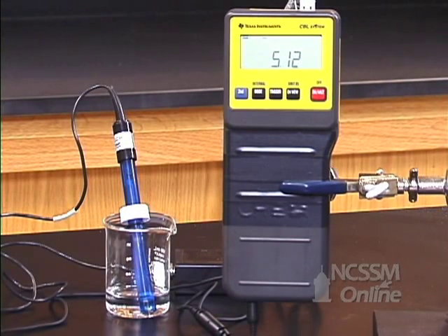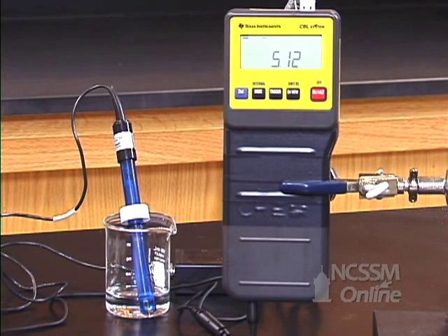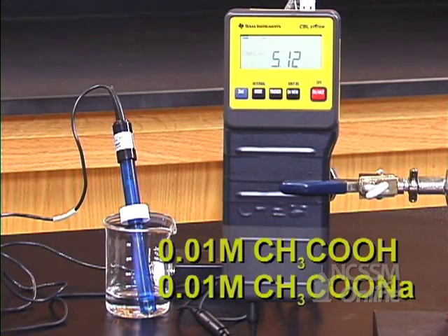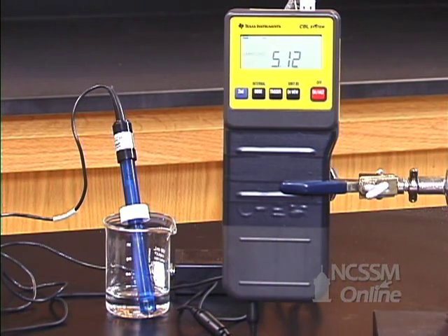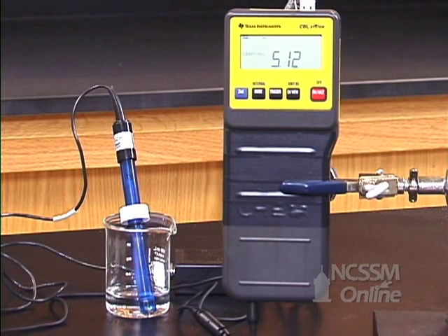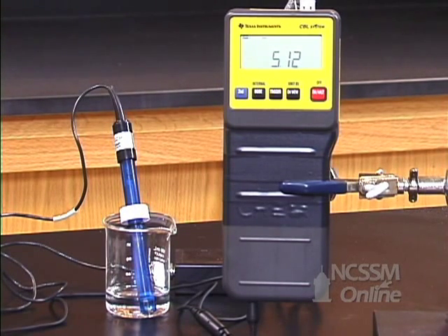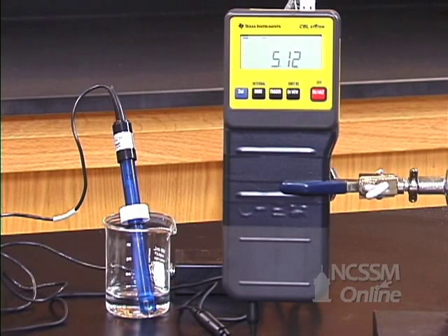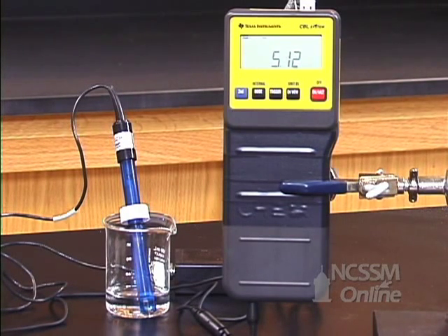I now have a solution that is 0.01 molar in acetic acid and 0.01 molar in sodium acetate. Notice that the pH of this buffer solution is very close to the pH of the 0.1 molar buffer solution. Remember that diluting the buffer does not change the pH of the buffer.